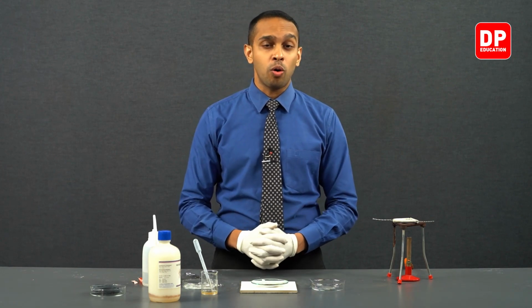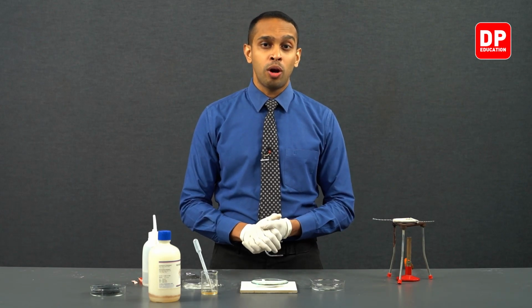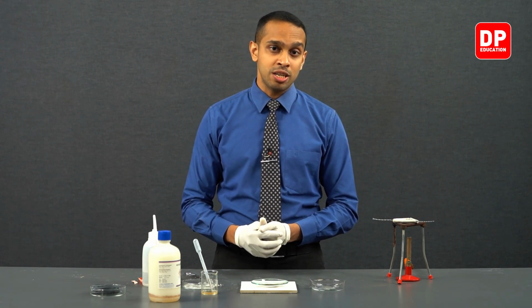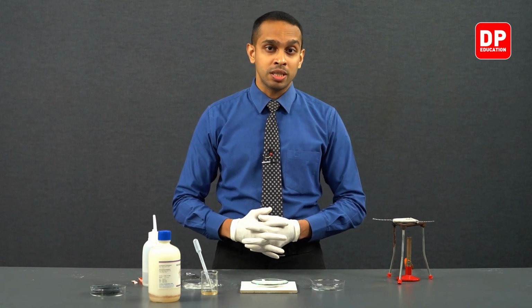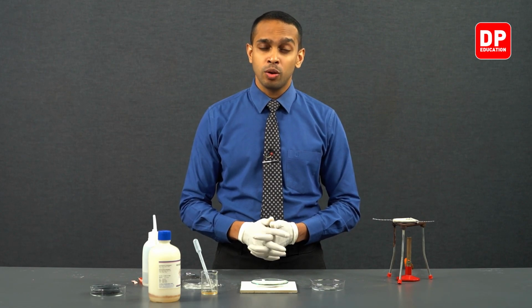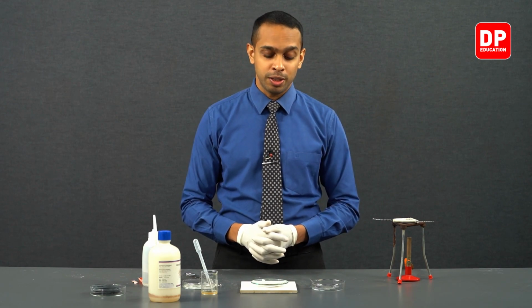So Nessler reagent will only produce a brown color precipitate if ammonia or ammonium ions are present in the medium. In this case, when we added aqueous Nessler's reagent, magnesium nitride reacted with the water present in the aqueous Nessler reagent and produced ammonia, which eventually led to forming a brown color precipitate.